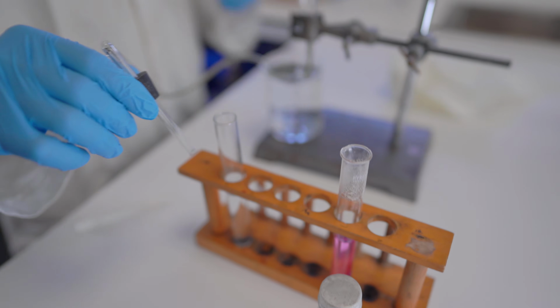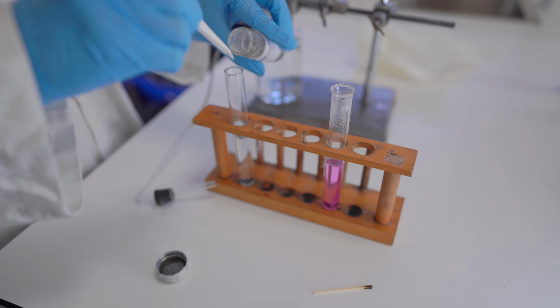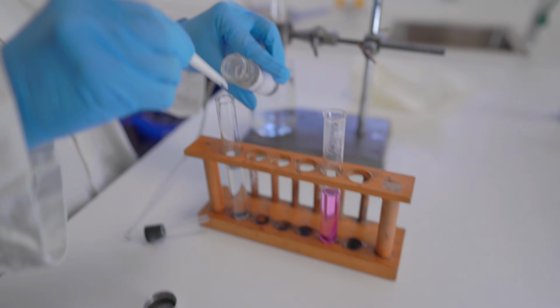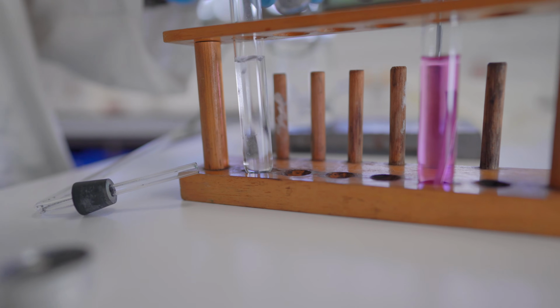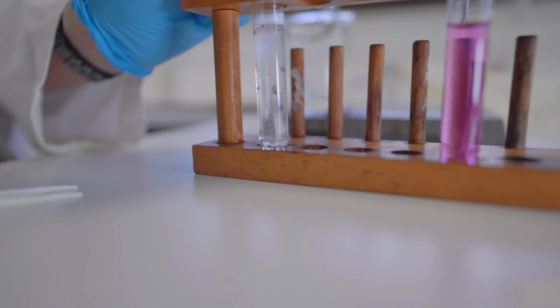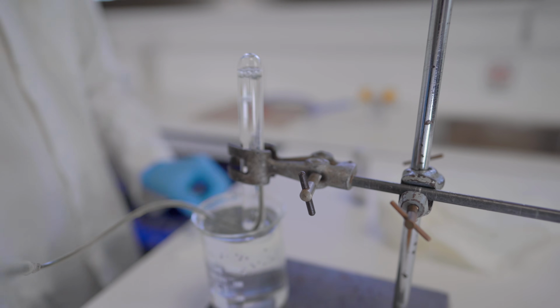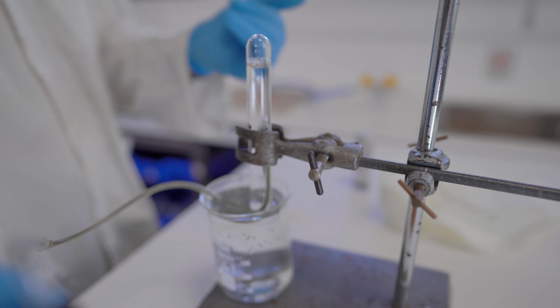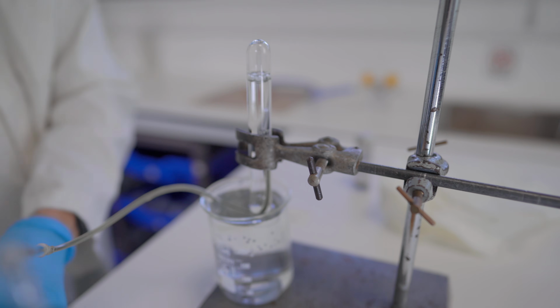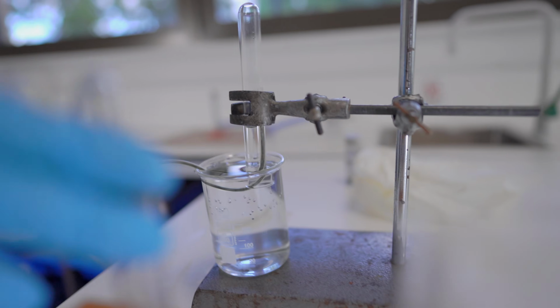I'm just going to drop in some calcium metal over here. This is still ordinary distilled water. Hopefully the camera can see if there's a change occurring down there. Now I'm going to add the seal, and if the camera turns its attention to the other test tube, we're just going to keep on collecting. I'm keeping some pressure here so the seal stays tight. We're now filling it up with whatever gas is being produced by this other test tube, which is looking pretty violent. We're nearly filled here.